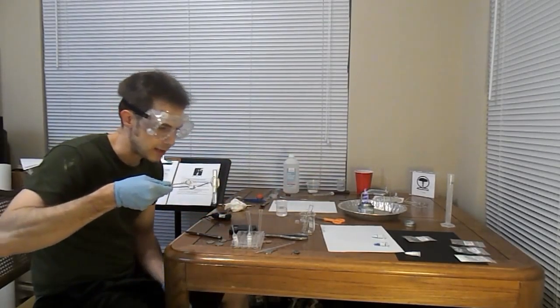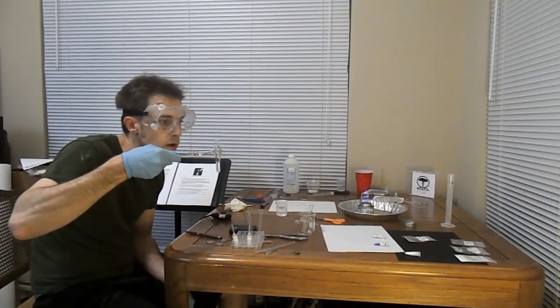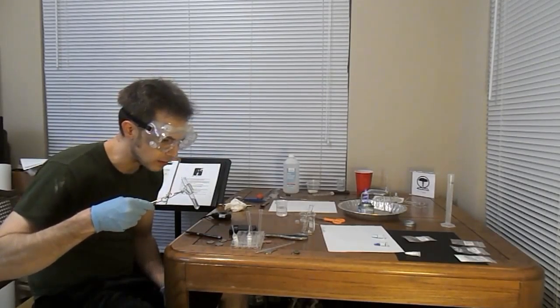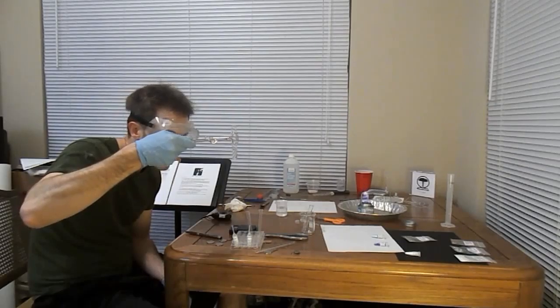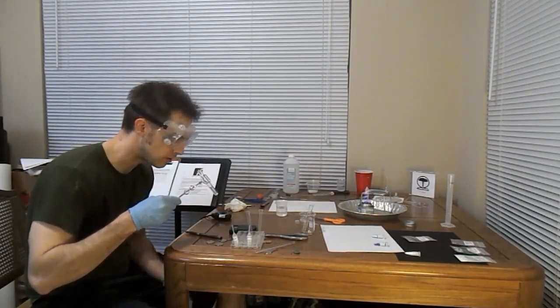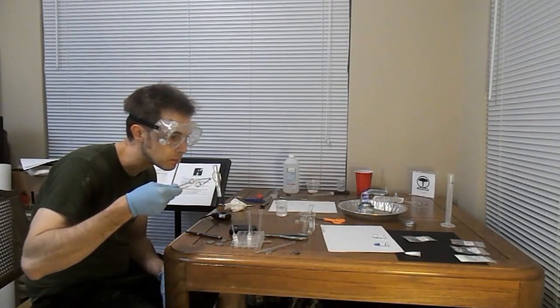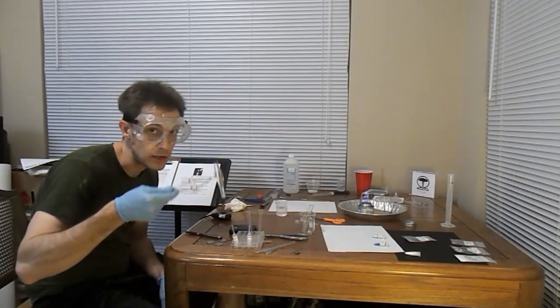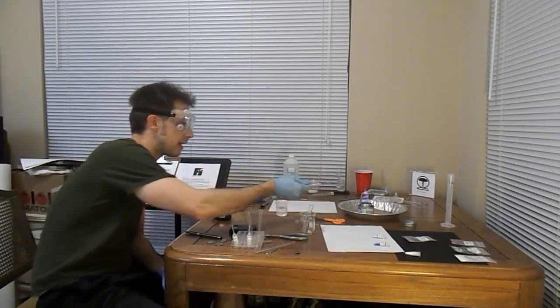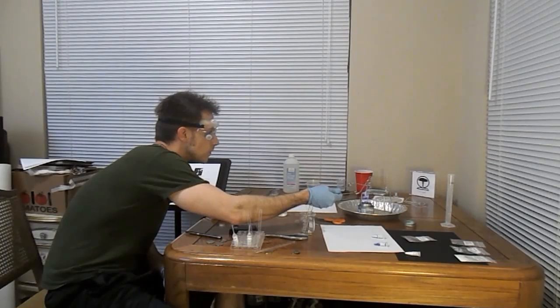Alright, before I heat it, I'm gonna shake that around. It doesn't appear to be doing anything at all, just kind of floating there. That is not any sort of solution I'm familiar with. I don't observe any changes at all. No change in color. Probably not a change in flavor. I don't know why we're not testing for that. I mean, okay, I kind of know. And we'll just heat this baby up right here.